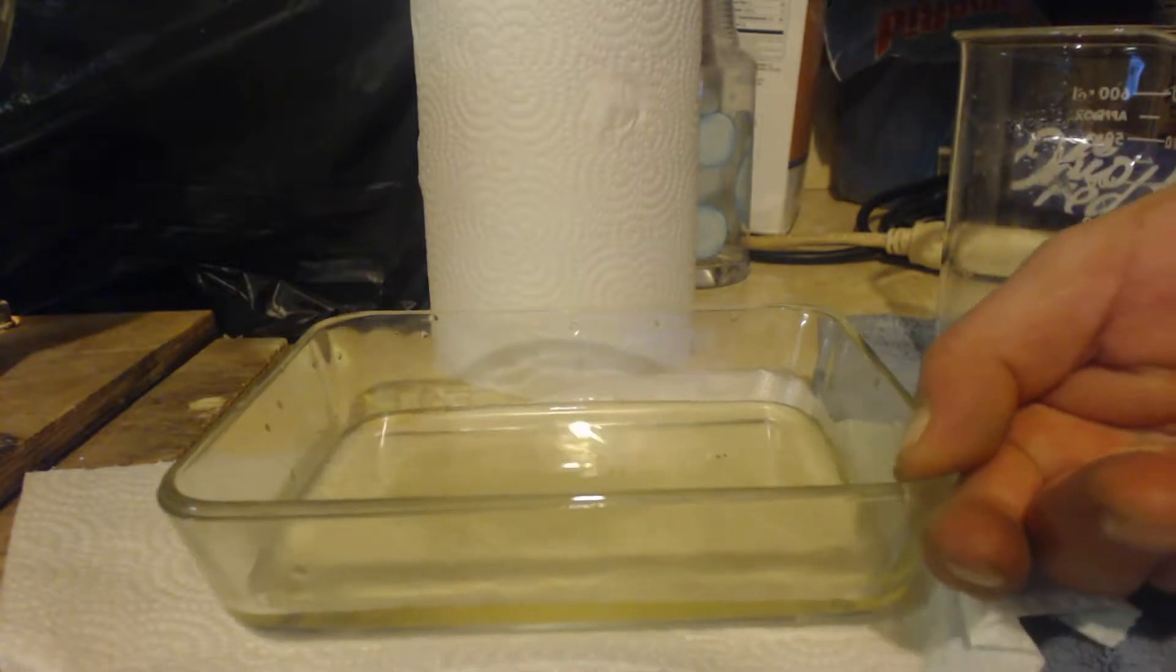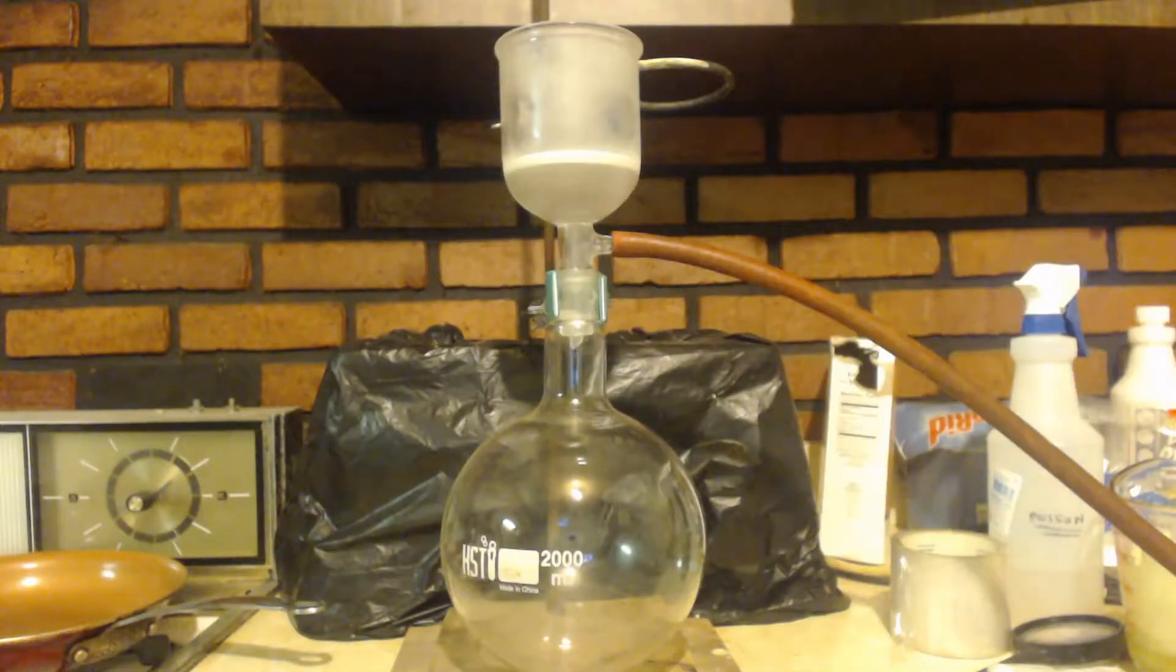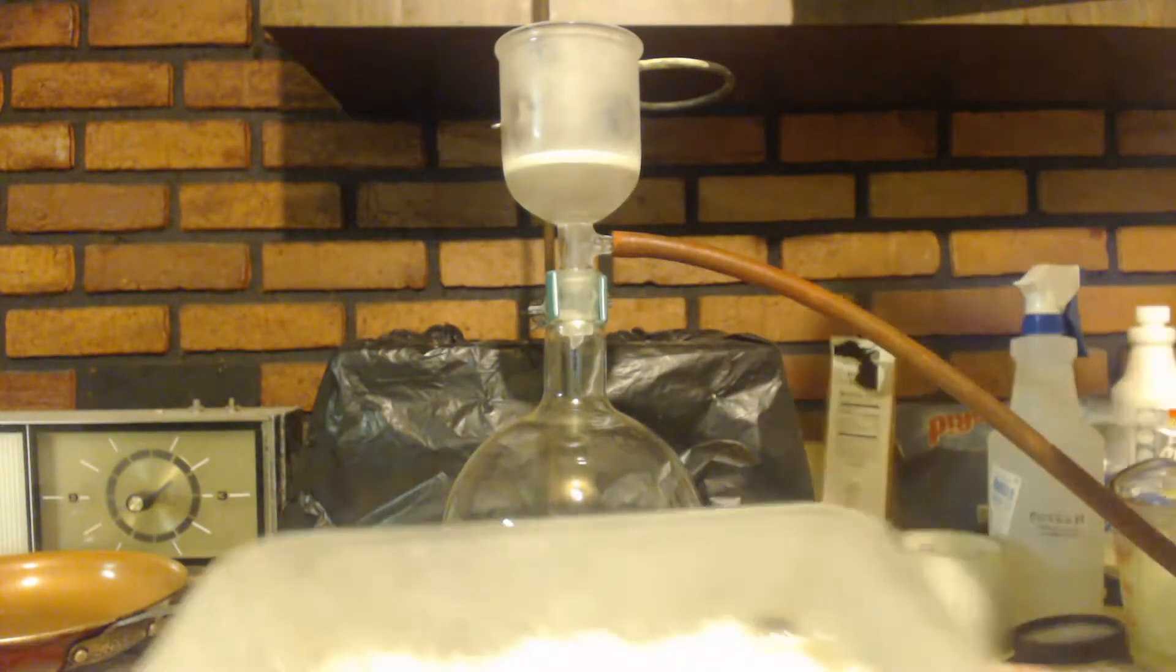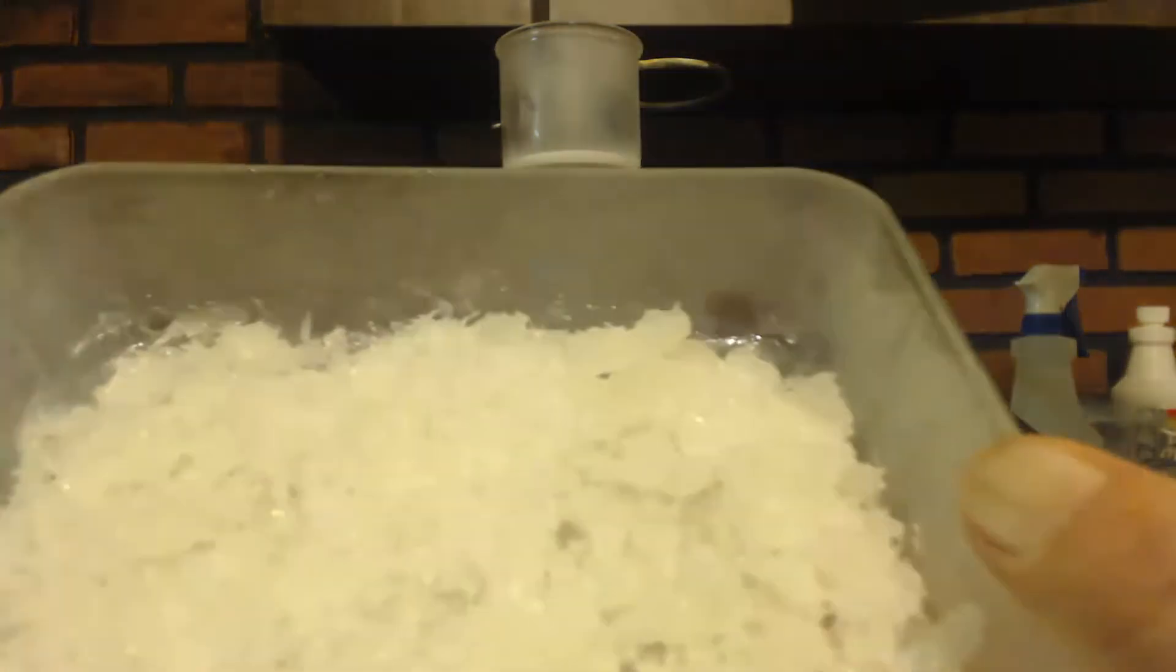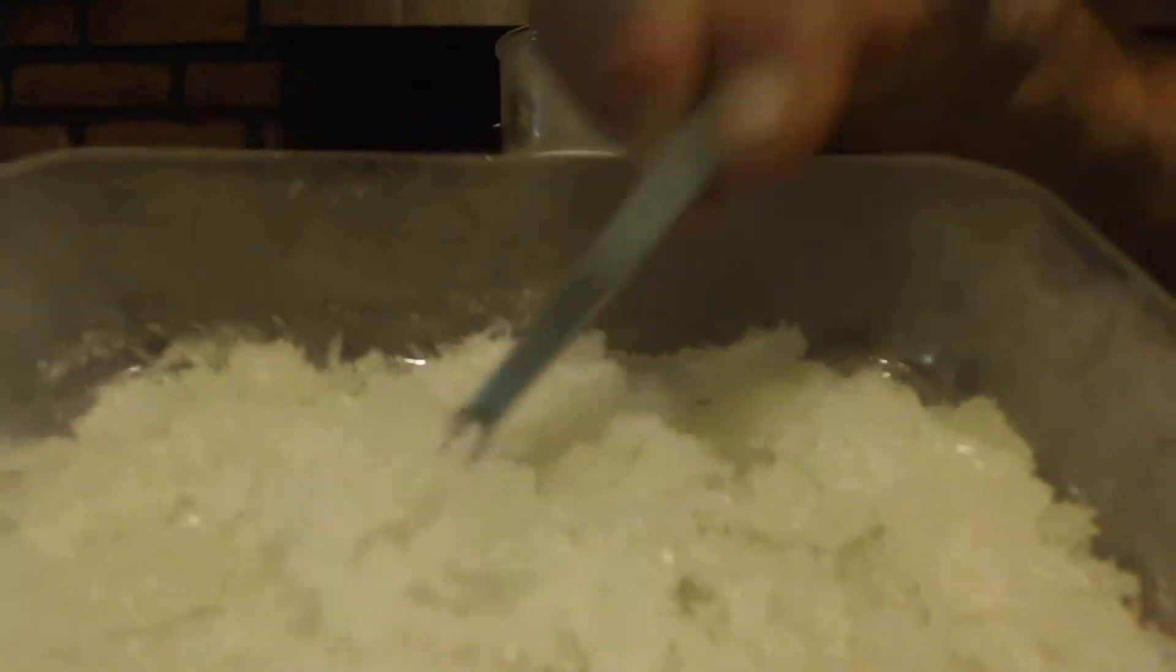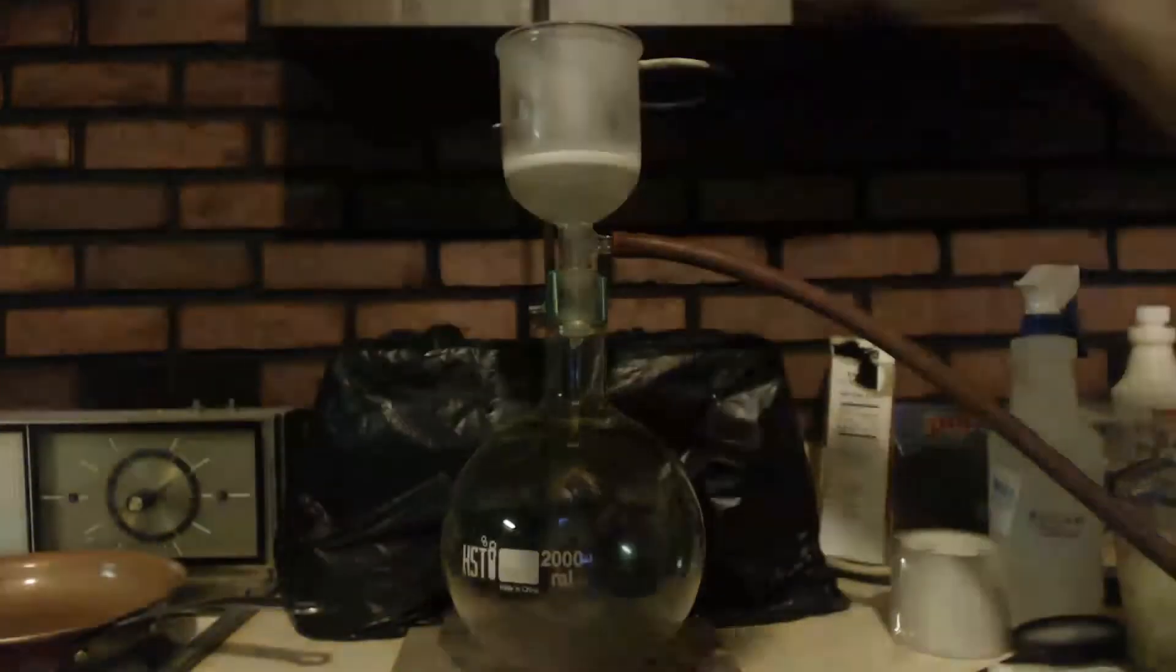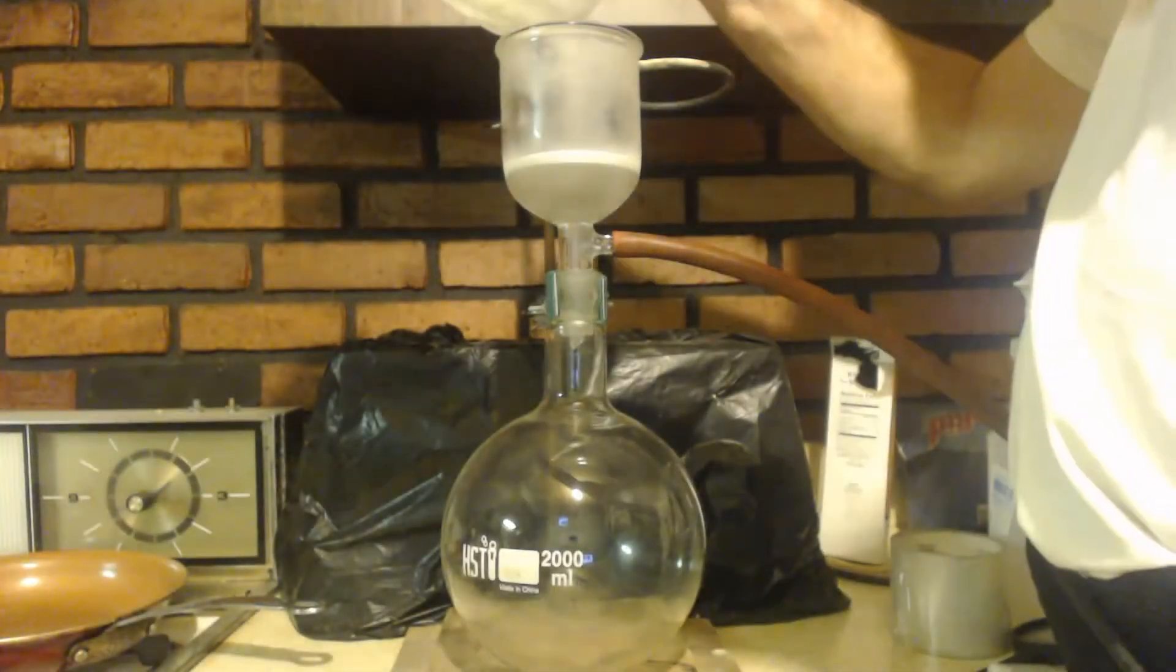Instead of doing it slow, I just decided to throw it into the freezer. You can see it's like slush now, kind of like snow. I'm gonna throw it in here into this filter.